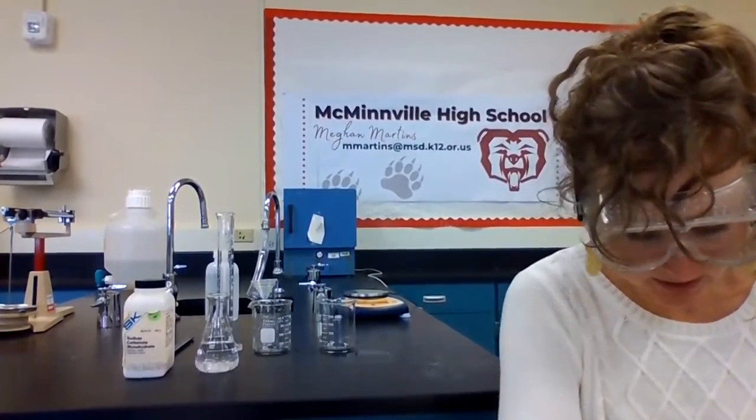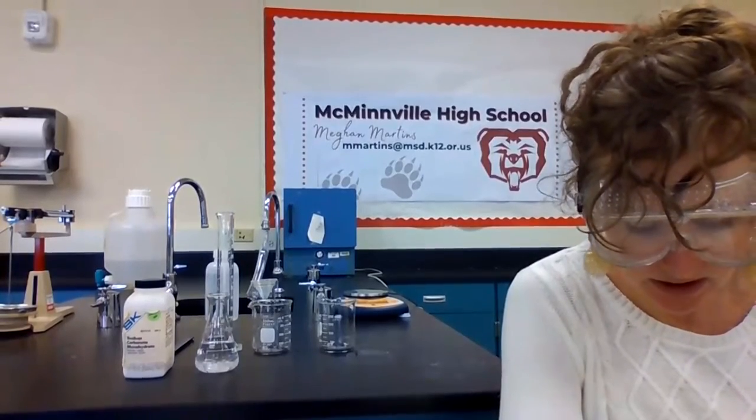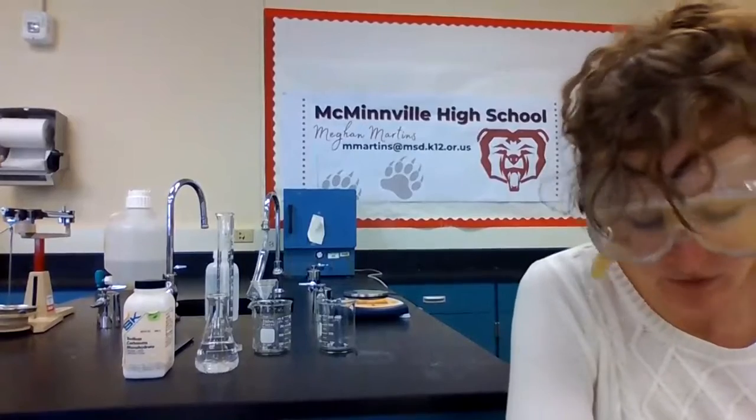And I found out that I would need about 0.52 grams of sodium carbonate in order to react with that completely. So I'm going to basically double that and use around 1 gram of sodium carbonate to react with all of that calcium in my tap water and hopefully precipitate it all out.